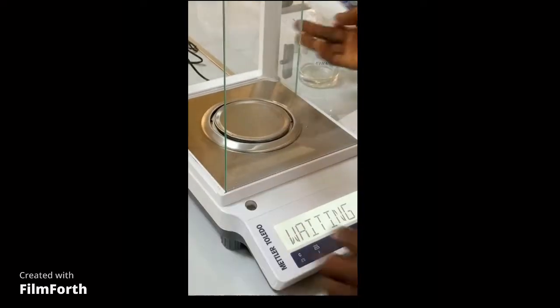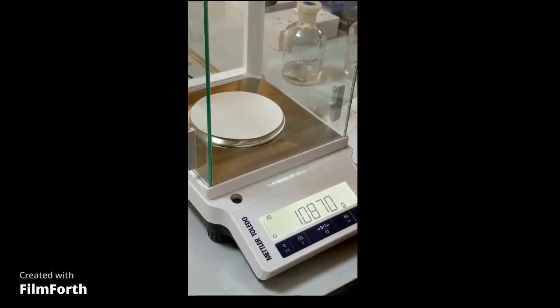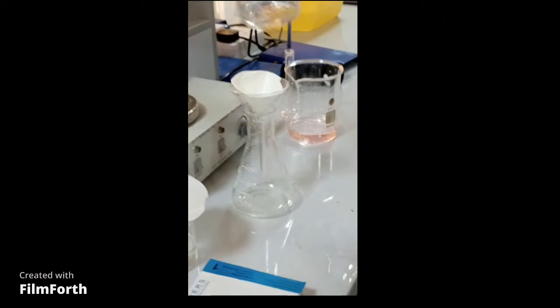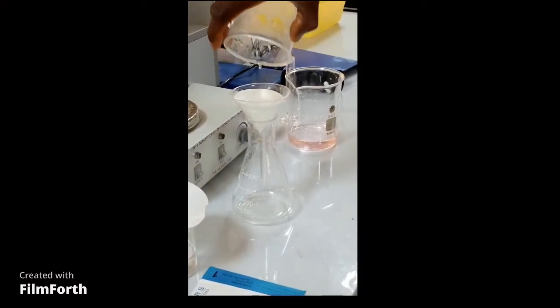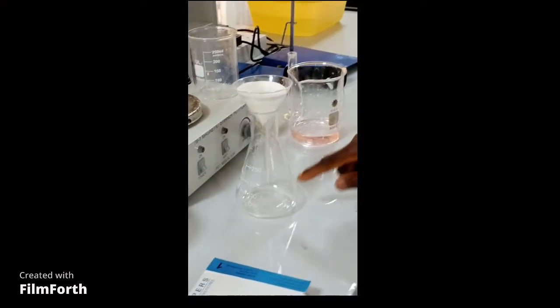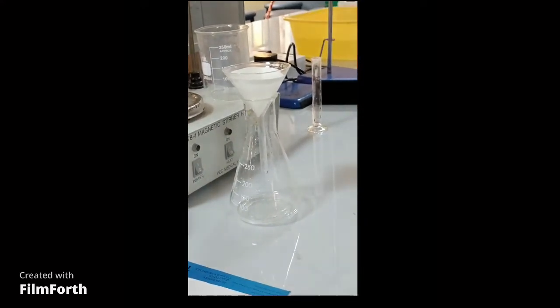At this point, we need to weigh our filter paper as we are doing the process of recrystallization. Weigh the filter paper and take note of its weight. Now filter the product while hot. It is the filtrate that we need — the product is inside the filtrate. There will be virtually nothing inside the filter paper.